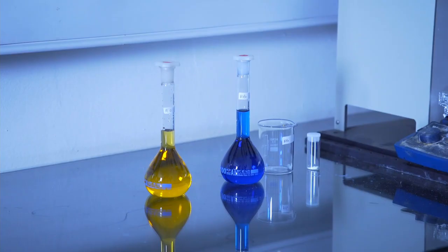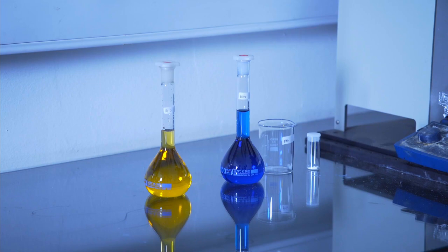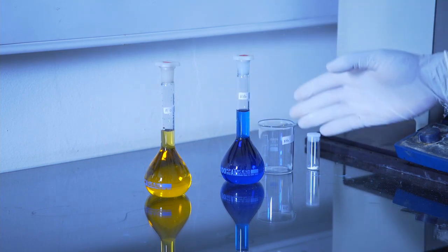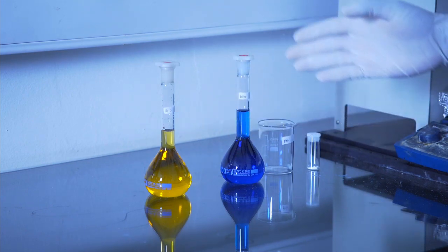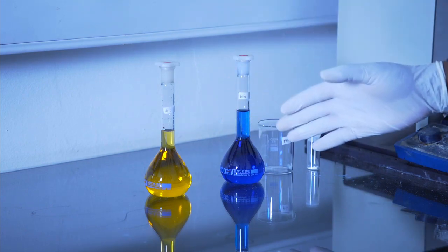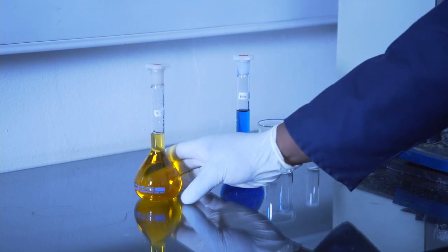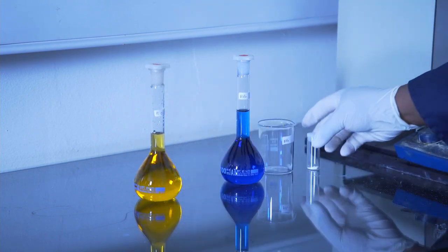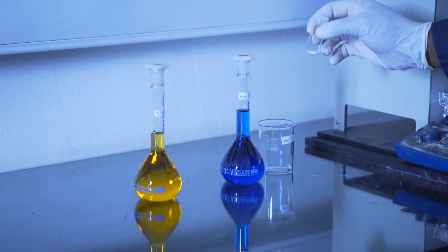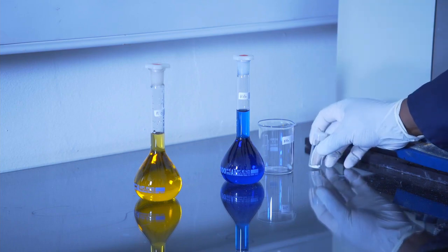In the first part of the experiment, a standard solution of methyl orange and methylene blue dyes are prepared. 20 ppm of each of the dyes is prepared in a volumetric flask, while 100 milligrams of the photocatalyst, which is zinc oxide, is also prepared for this experiment.